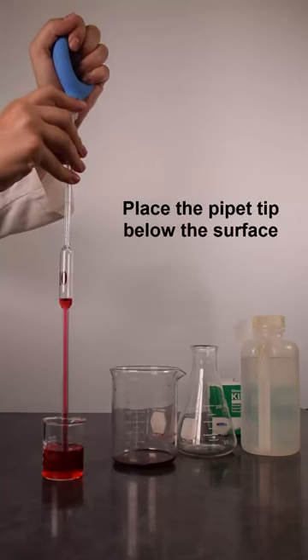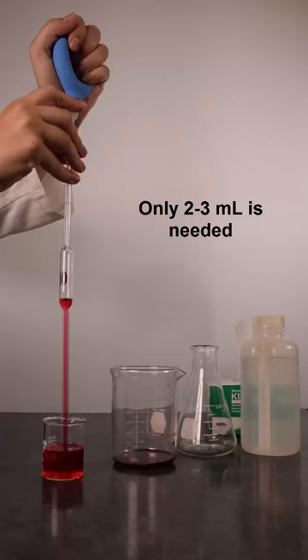Place the pipette below the surface and continue to release pressure on the pipette bulb to draw up approximately 2-3 milliliters of solution. Note that you should not fill the whole pipette when rinsing. Filling just above the bottom of the bulge of the pipette is more than sufficient volume to rinse with. Anymore is a waste of reagent.